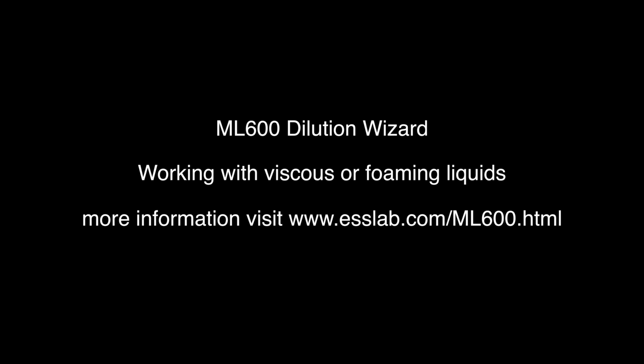Yeah, it's particularly relevant actually, Chris, when you're using biological samples. In many instances, things like serum, plasma or whole blood have difficulties when you're aspirating at higher speeds. So we have an option in the advanced function here. Within the advanced functions, we have options for the fill, aspirate and dispense speeds.